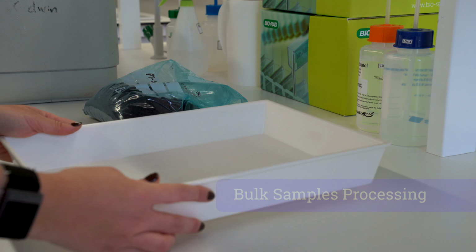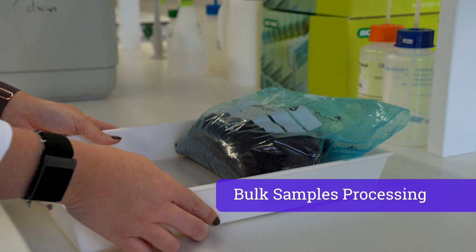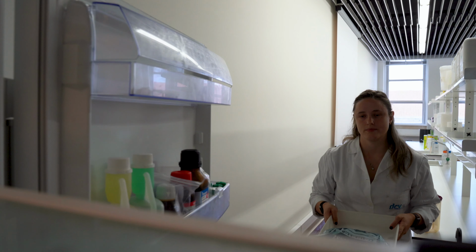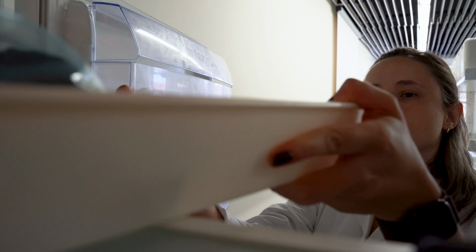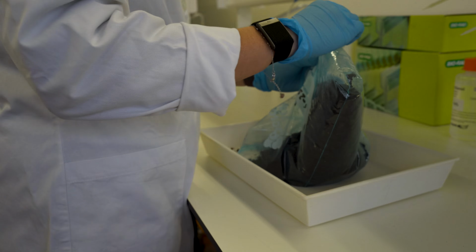If immediate processing is not possible, store soil samples at 4 degrees Celsius. Ensure the bags are properly sealed to prevent moisture loss. Samples should be processed within 24 to 48 hours after collection to avoid changes in soil properties.